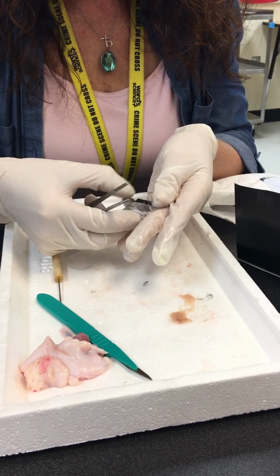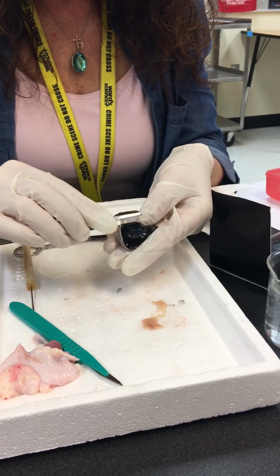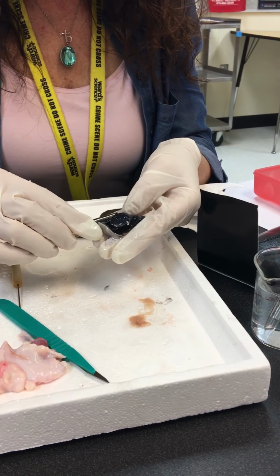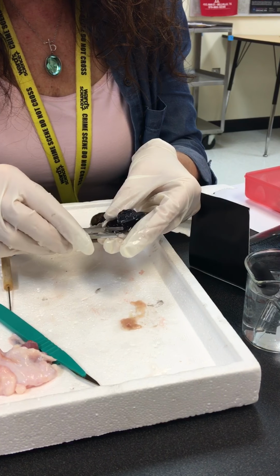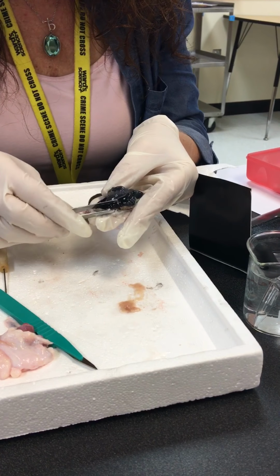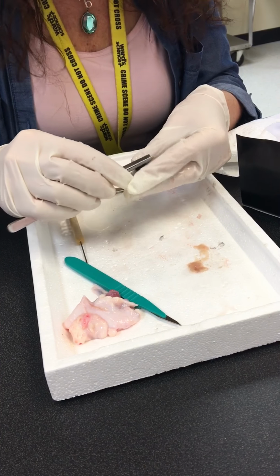You can well guess that this is our lens right here. If I were to pop that lens out, and I'm not going to do it right now because I'm trying to get to some of our other structures. Is that where the aqueous humor is? Yeah, you've got some aqueous humor in here, but you also still have some vitreous humor. Remember, the difference between the two is one's watery and one's gel-like. The aqueous humor is the watery portion, and the vitreous humor is going to be more gel-like. Think of vitreous as grapes on a vine, and a grape is kind of like a gel. And aqueous is water.